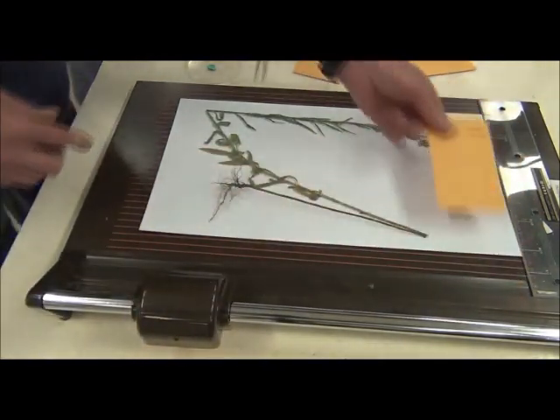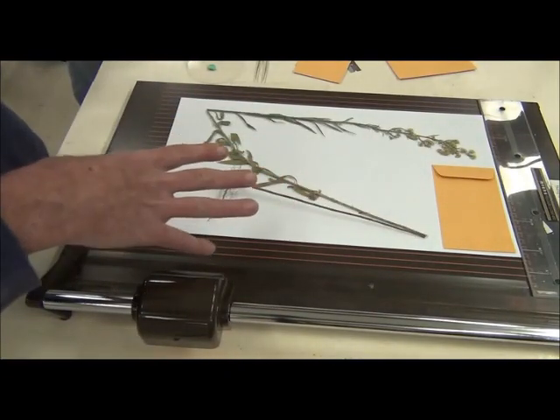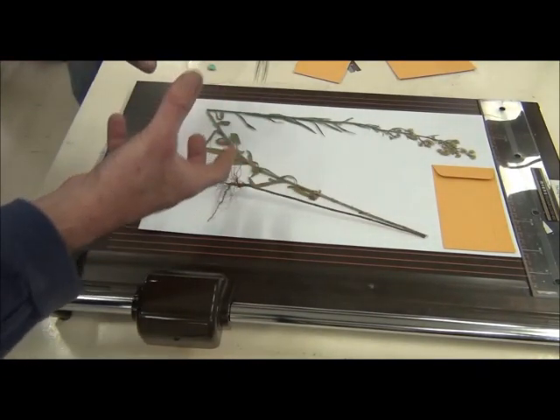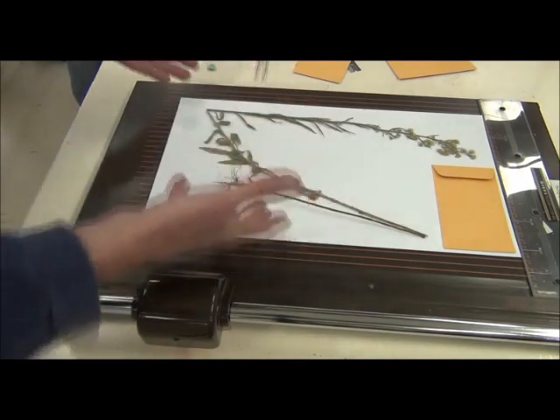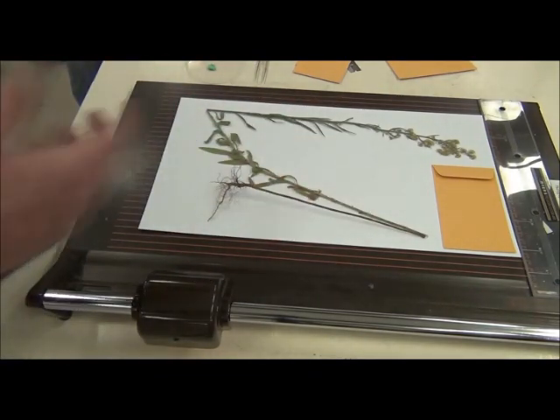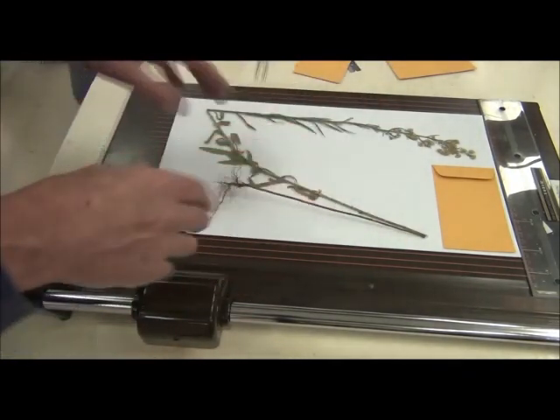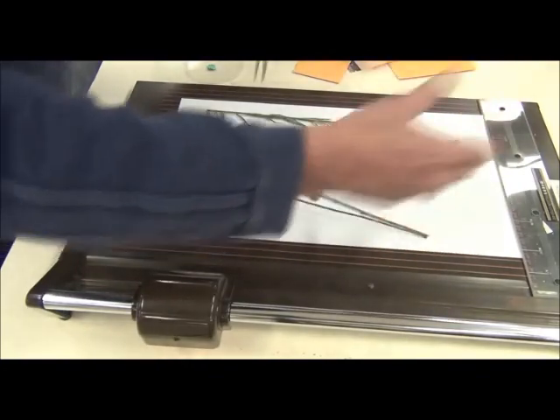Now, so it's good thinking about those placements before you start getting going because what you don't want to do is mount the specimen then go, oops, where am I going to fit the envelope if you have one. So it's worth thinking about that at this stage. So I'm pretty right there.